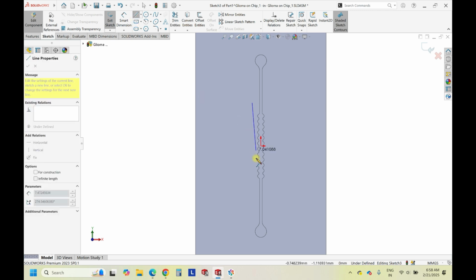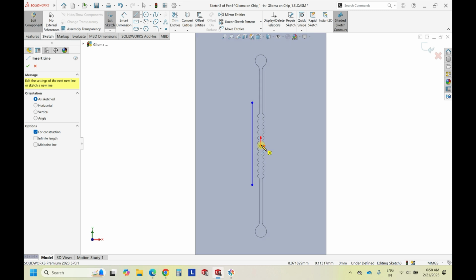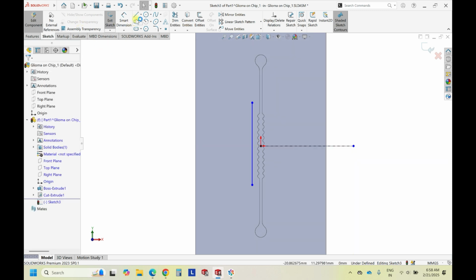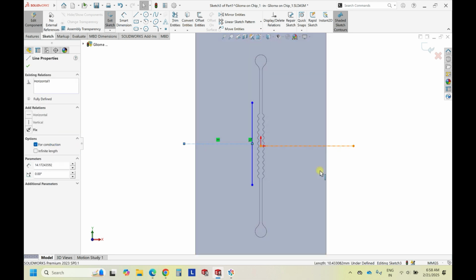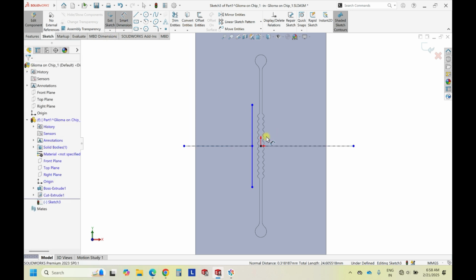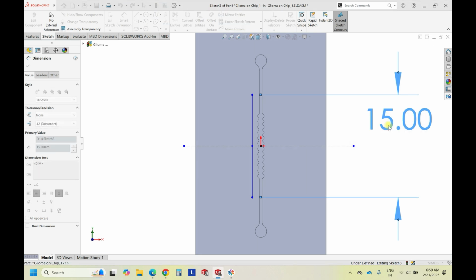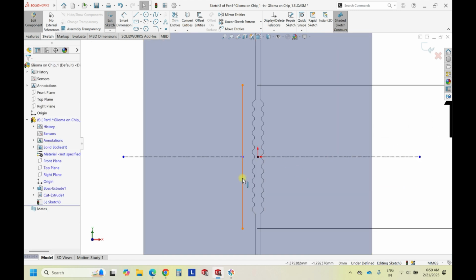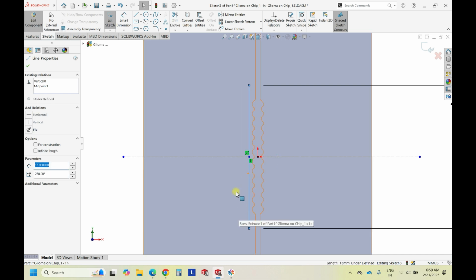So let's draw a line over here. Okay. So like previous, let's do a collinear operation over here. Give the channel dimensions as... So it was a 10 mm channel, so it can be 15, or let's reduce it to 12. This has to be in connection to this, or it can be more. Right. Let's do it in two ways. Okay.